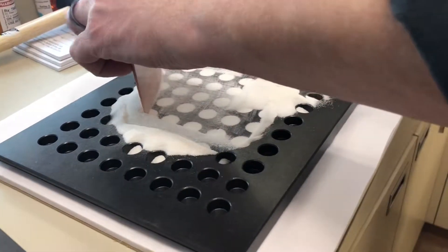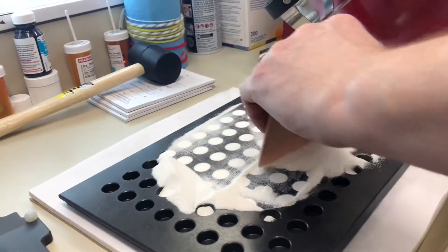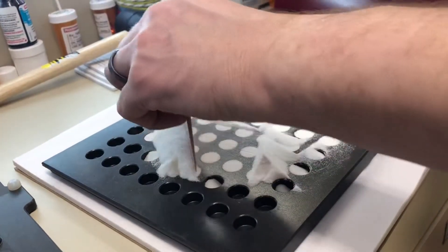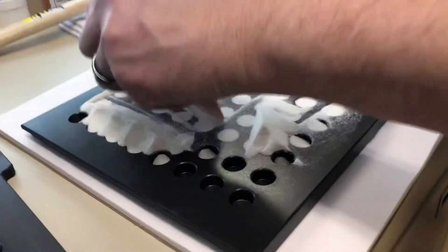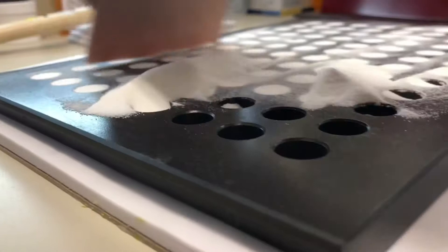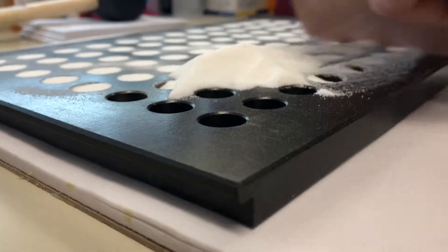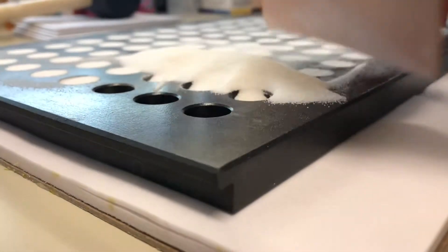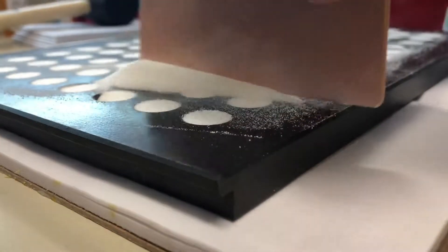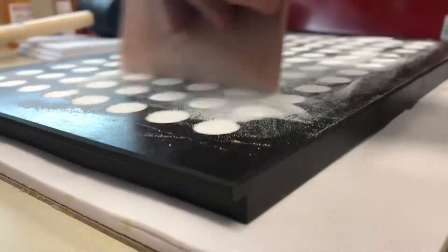The base for this Rapid Dissolve tablet is a specialized product that, when cooked and then cooled, allows for a solid dosage form. It's one that dissolves very quickly under the tongue, so when you give things sublingually it goes directly to the site of action and avoids the liver.